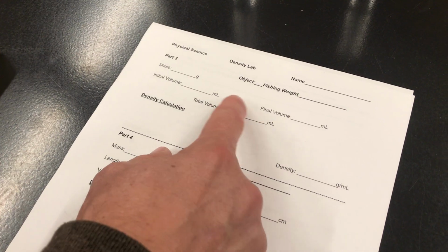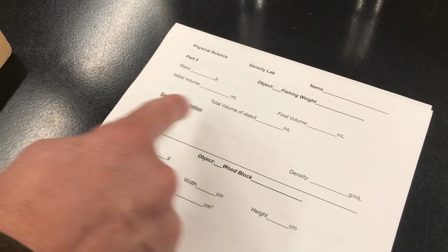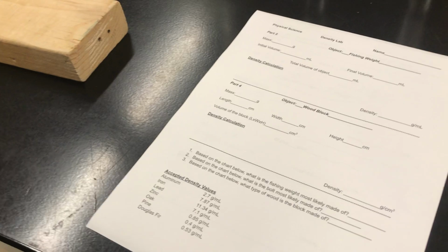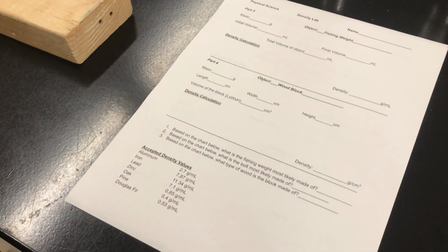Your job: calculate the overall volume change that represented the weight, and then do your density calculation. Please make sure you show your work. Yep, that's what the space is for. Show how you set it up and where the numbers go. That way if something is wrong, we can figure out what went wrong and how to fix it.